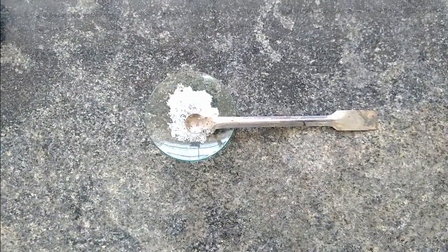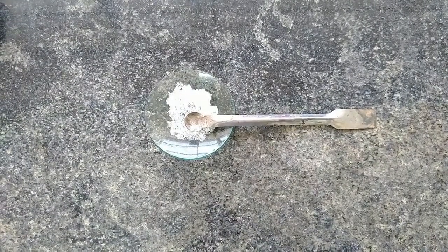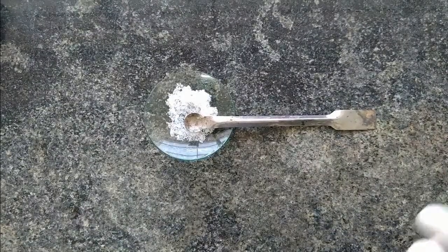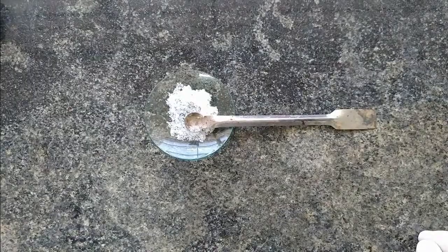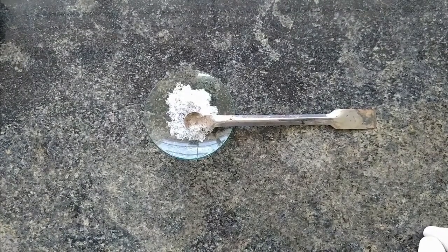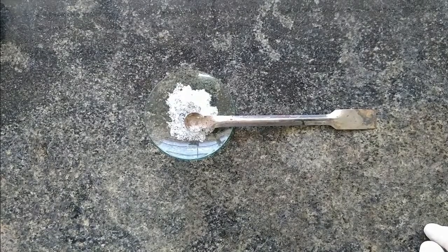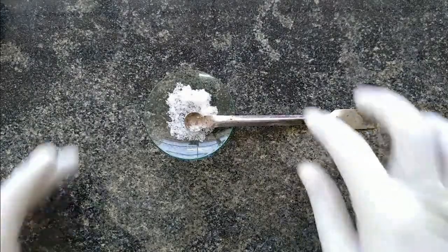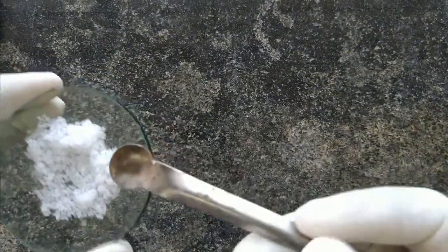Hello students. In this video we are going to start with systematic qualitative analysis, and this is the fifth salt. As usual, we are going to detect one acid radical and one basic radical. Before going for the detection of the acid radical and basic radical, let us start with preliminary tests. The first preliminary test we are going to see is the state.